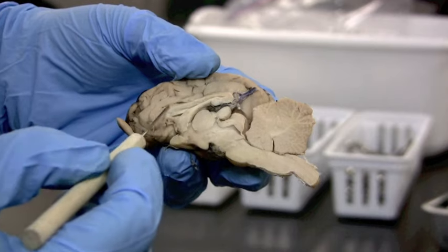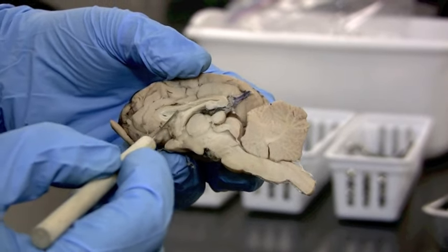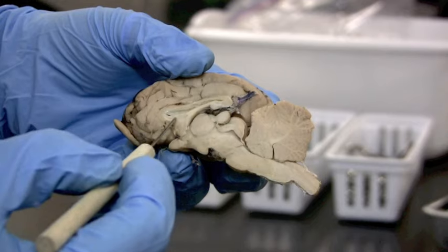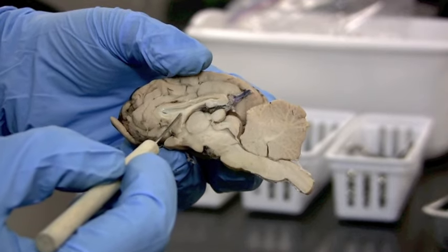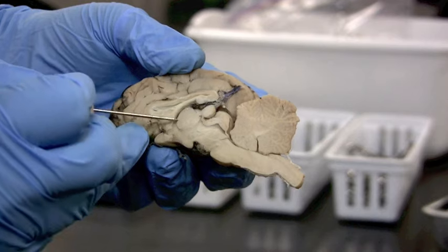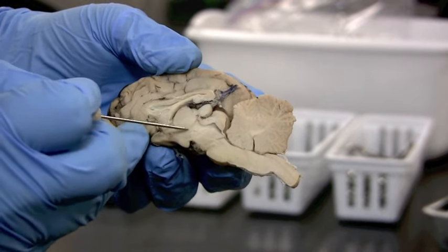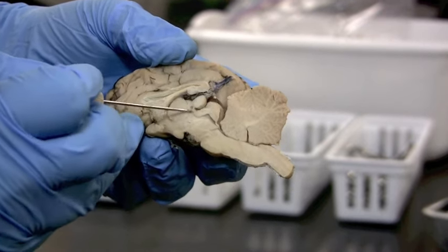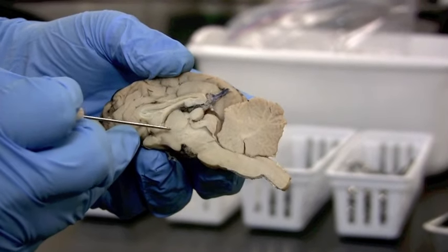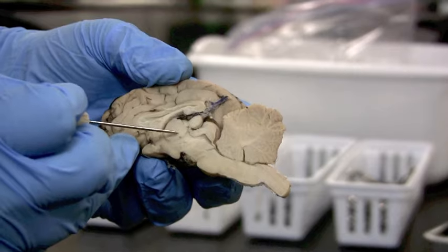Here's that other half where we had the corpus callosum and the septum pellucidum in front of the lateral ventricle. Down below we have this really well-formed circle — it's a very circular bit of tissue, and that is the thalamus.